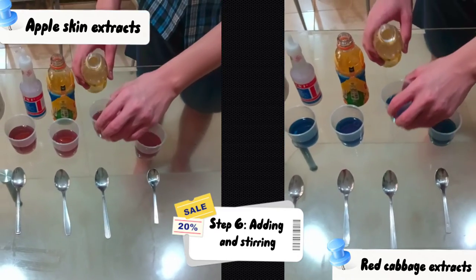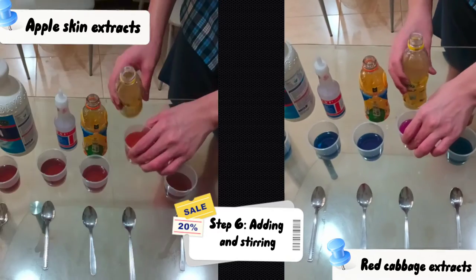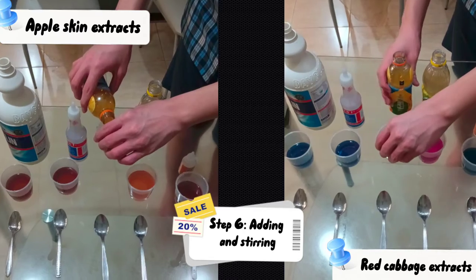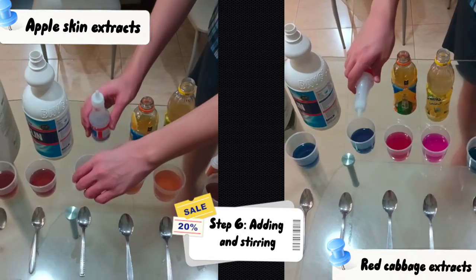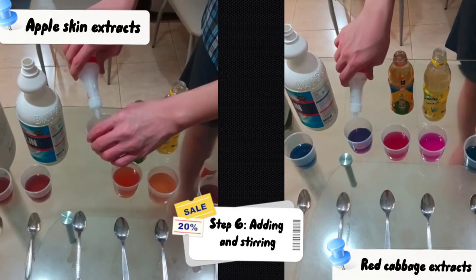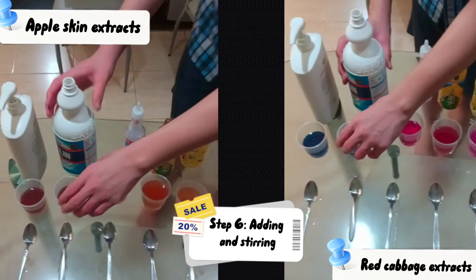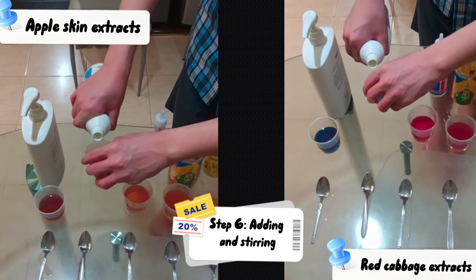The lemon juice. The orange juice. The vinegar.